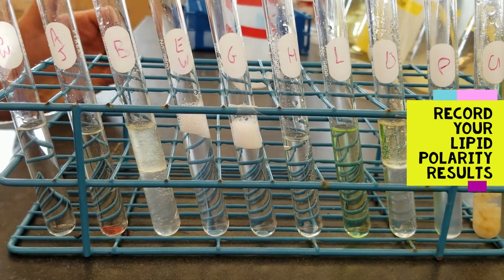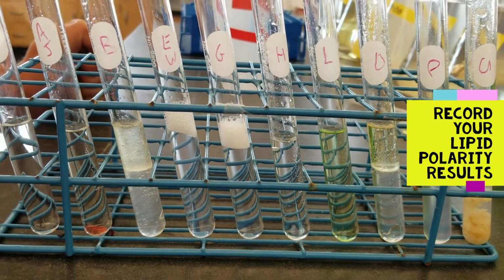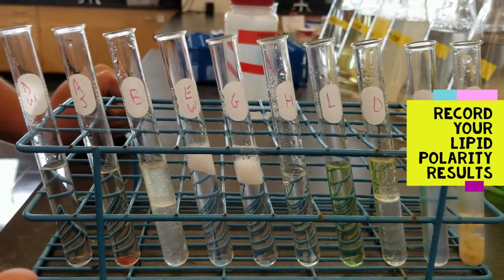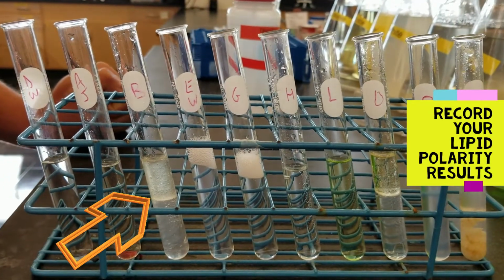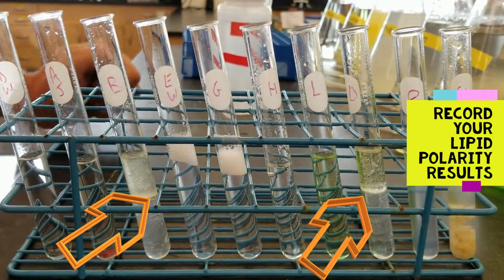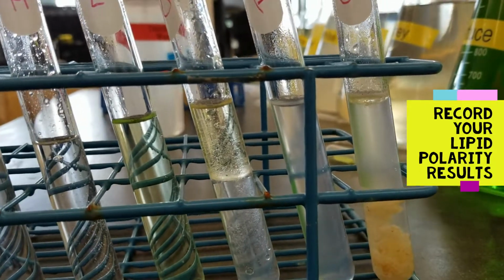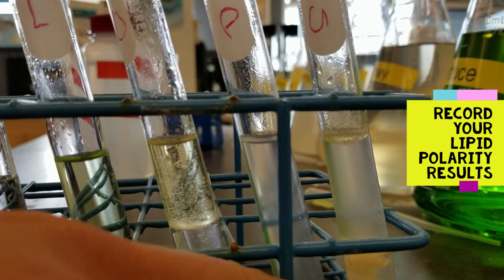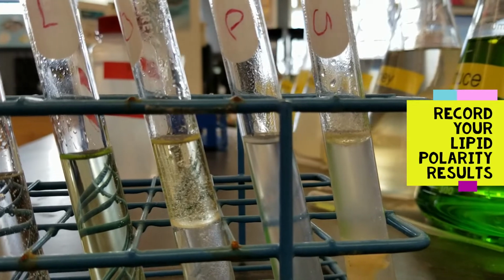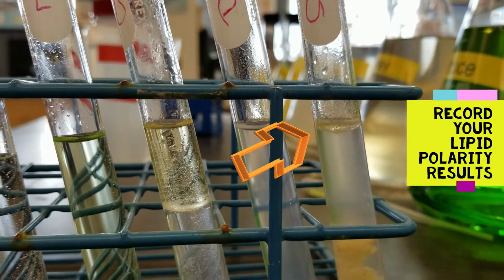Okay, but are there any clear layers that you can see? Definitely with the butter, I see two distinct layers. With the oil, I see two distinct layers. And with the unknown, do we happen to see two layers amongst all the contents of this poor guy's stomach? Well, it looks like there's a small layer right at the top.